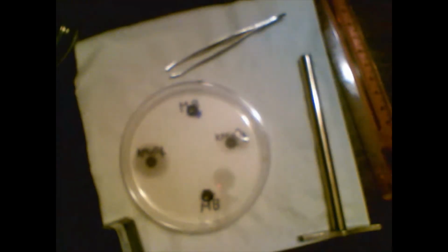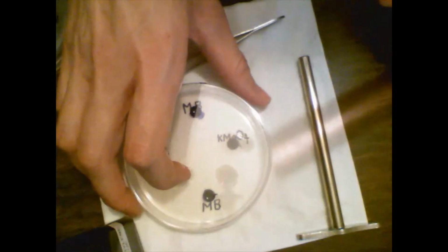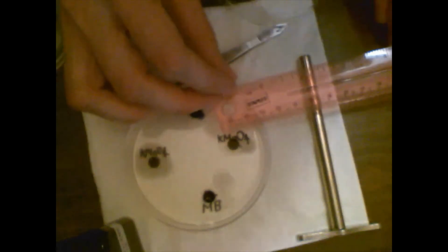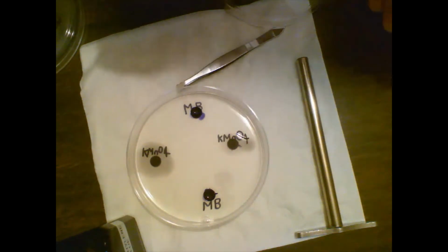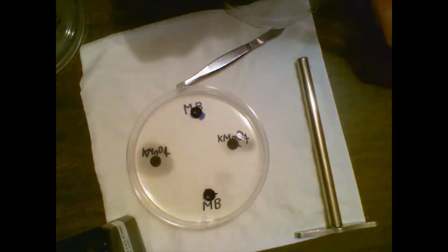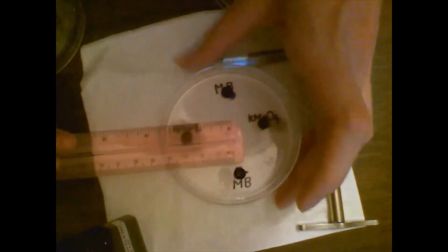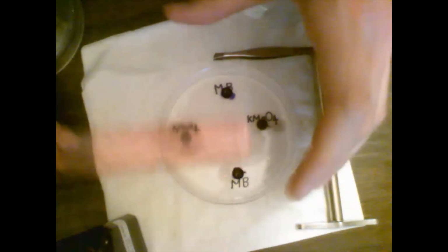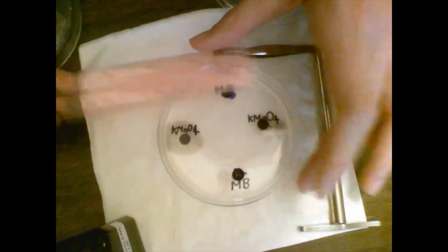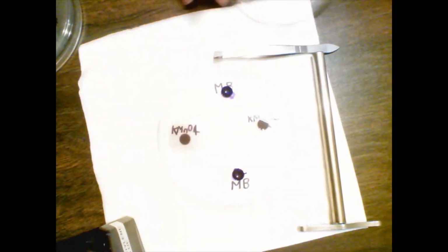So what we're going to do is take a measurement. We're going to cover this, and we're going to start off with the diameters. We're going to place the Petri dish and replenish the chemicals in the holes after 15 minutes. You're supposed to measure the diameter of each circle in millimeters after a total of 40 minutes. We can measure the holes in millimeters, and then after 40 minutes, we're going to measure how much they moved.